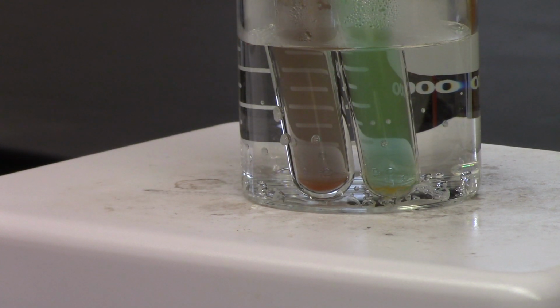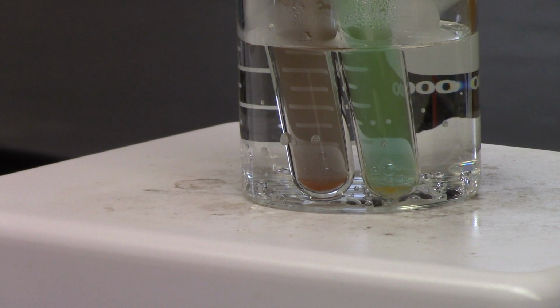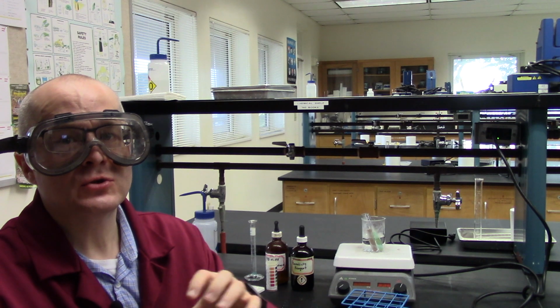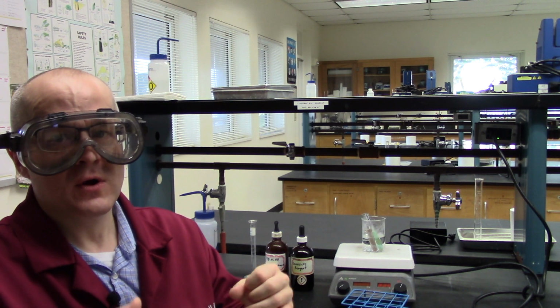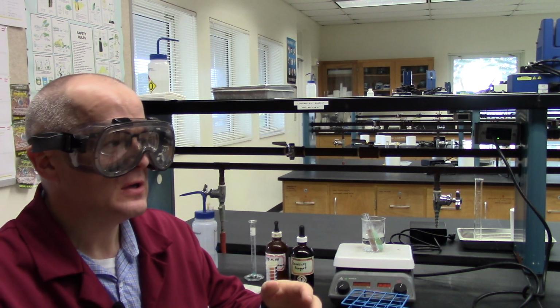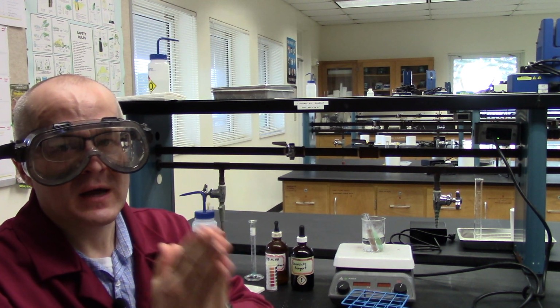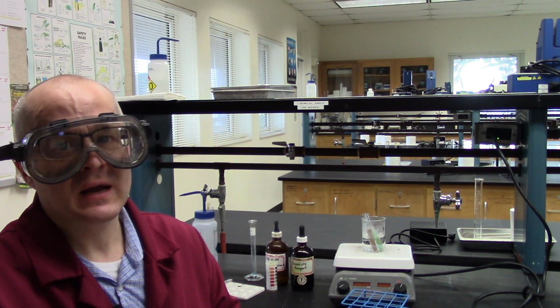All right, guys, we're back again, and as you can see, the glucose is definitely turning brick orange, or brick reddish orange. That's a positive test for glucose, so that's really kind of cool. The acid solution in starch, after heating it for about 10 minutes in near boiling water, the starch digested into glucose molecules. And the glucose molecules we confirmed using a Benedict's test. The Benedict's test for glucose told me that this is most definitely a digested starch with glucose present. Isn't that kind of cool, guys?